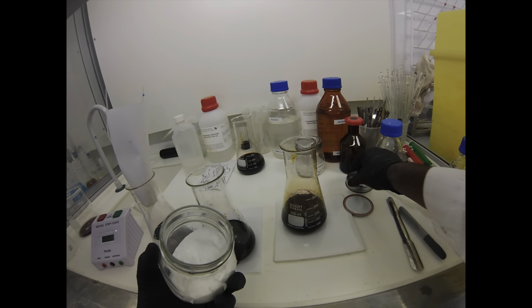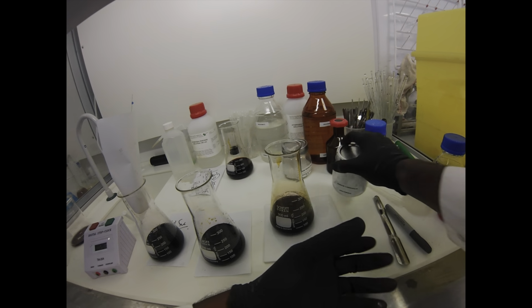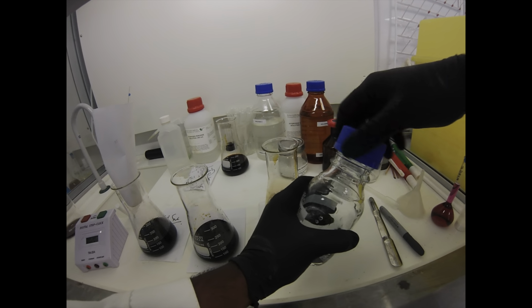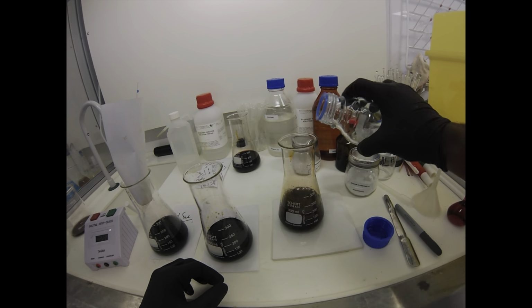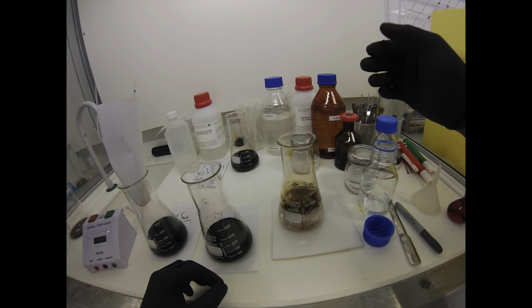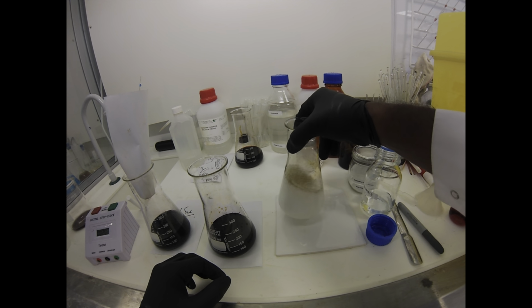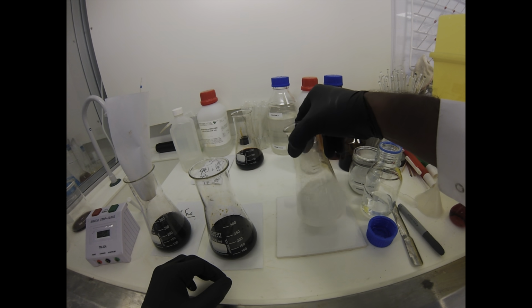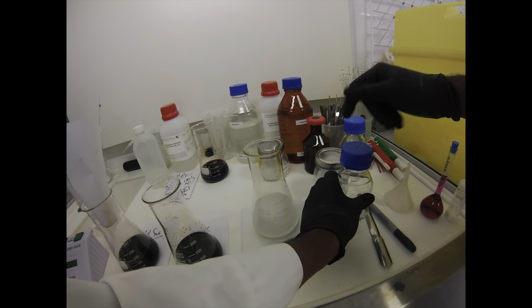With really large batches, if we've done this multiple times, then what I'll do is I'll just put it on a stir on a really big beaker. And I'll just constantly add thiosulfate as the day goes on while it's stirring. This is carbonate solution, so same thing, probably a bit more controlled, 1 molar carbonate, but you're still going to get that fizzing from that acid-base reaction. And again, the final step is down the foul drain with plenty of water.